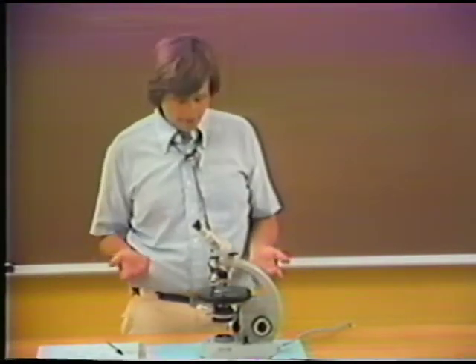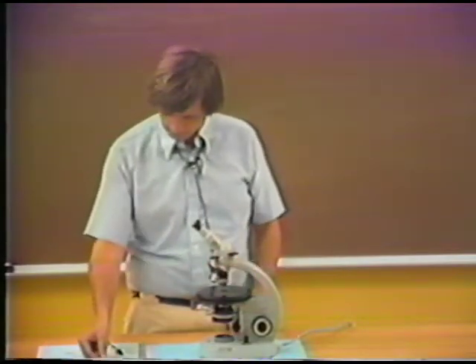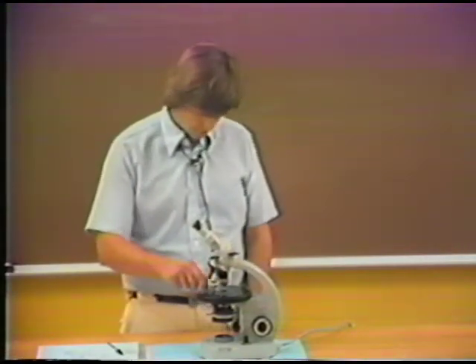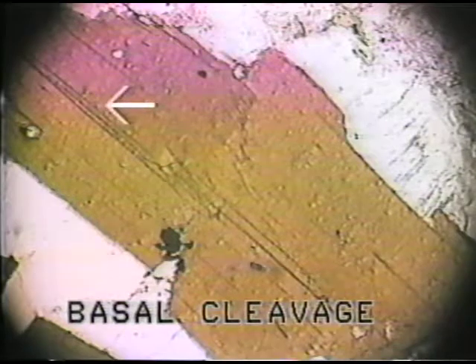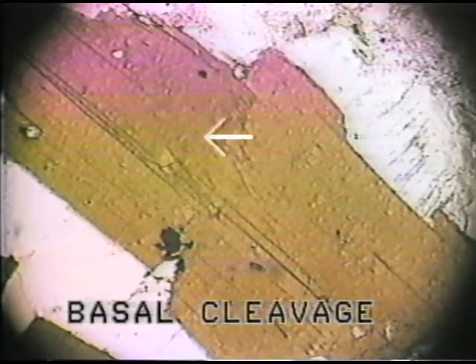Well, there are other patterns of cleavage, and in order to show this, I'd like to give you a thin section which contains biotite. Biotite has a very well-developed basal cleavage. And here we're looking at a biotite grain where the basal cleavage form is very well shown. The platy form of the biotite mineral induces what we call a basal cleavage. This is a cleavage that is perpendicular to the c-axis and is extremely well developed in, well, all the micas, biotite in this particular kind of example.